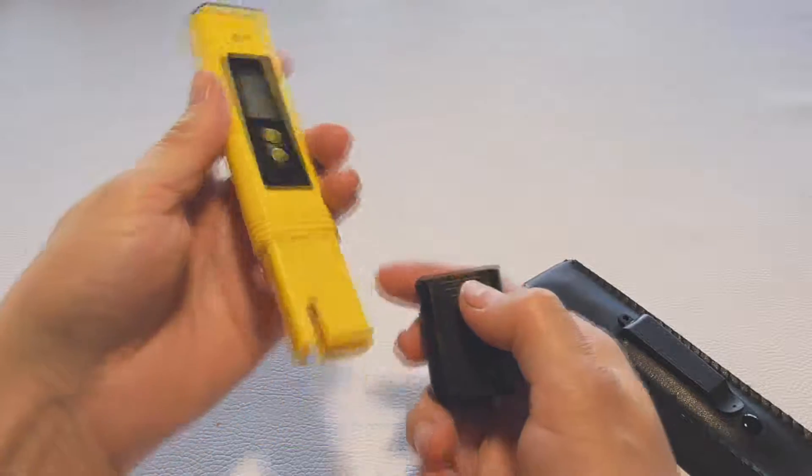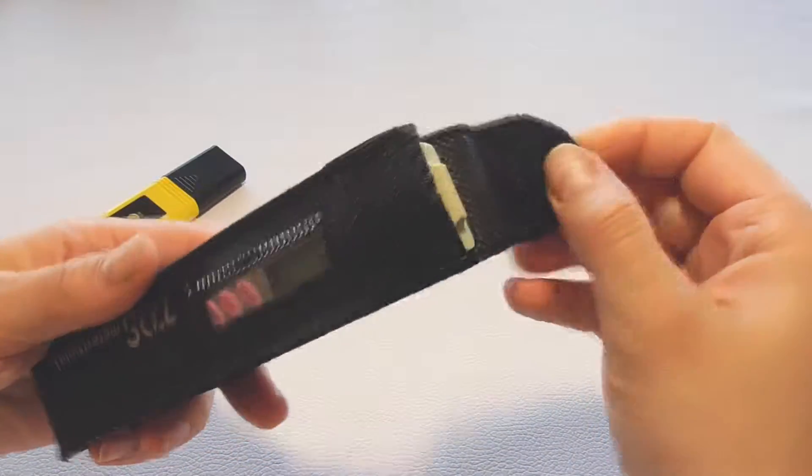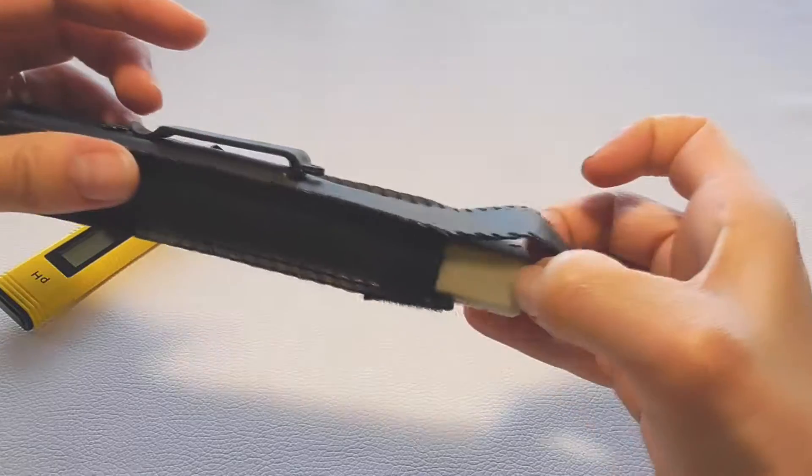You can remove the cap and put the lower part into the water and test your drinking water. The other one, which for some reason is in a leather case, is a TDS meter.